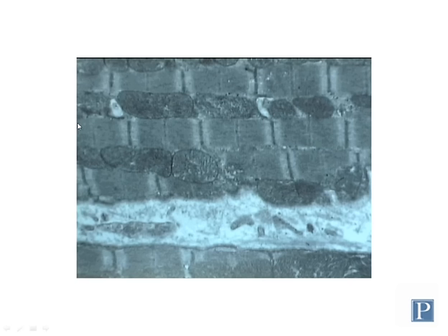And one single skeletal muscle cell can contain hundreds of these contractile fibers. And here we see, here's a single contractile myofibril, and here's another one here, here's another one down here, here's another one up here.